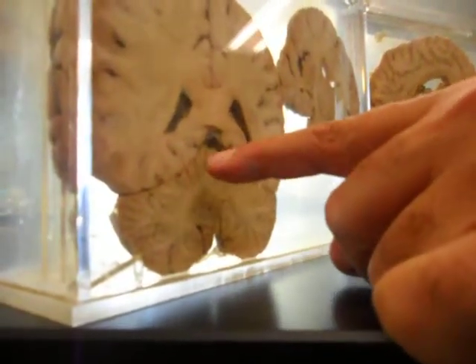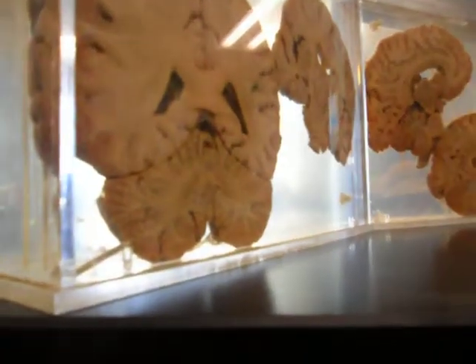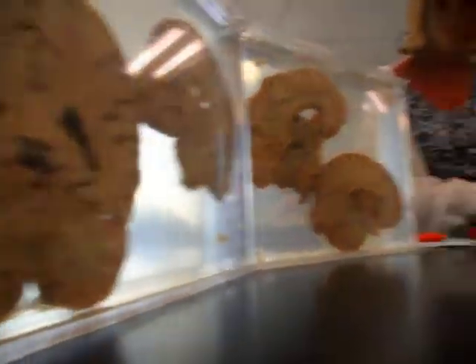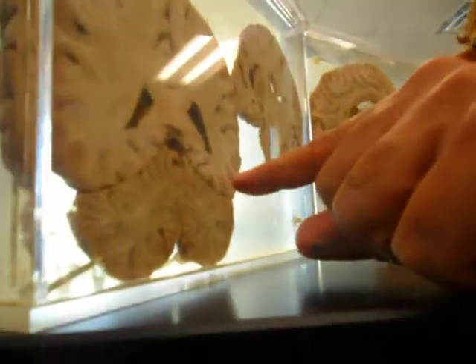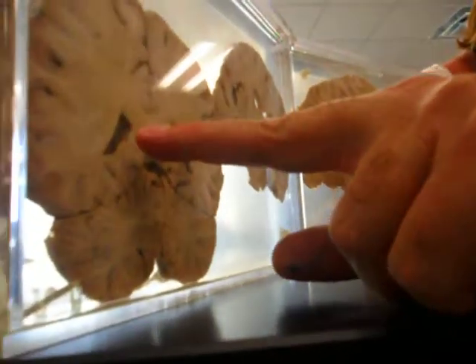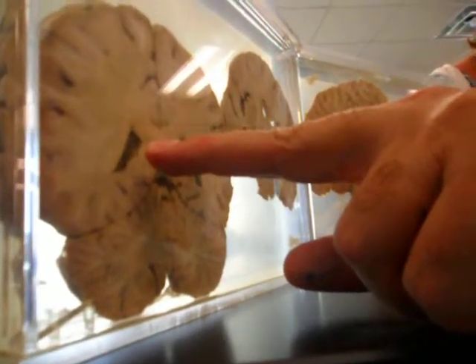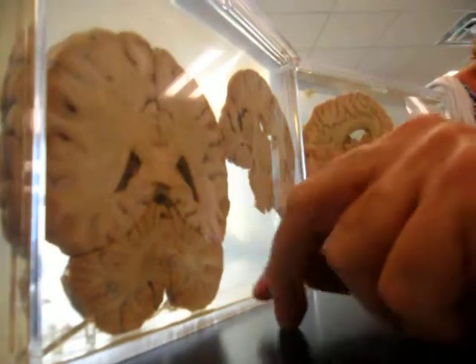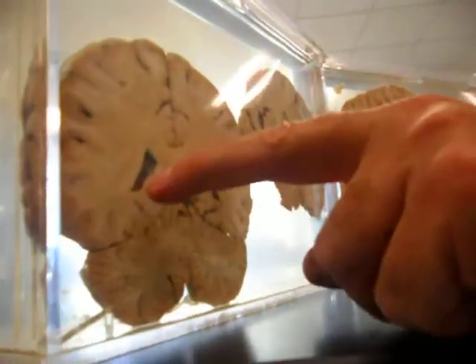The parietal occipital? Nope. Or occipital parietal? Nope. What line separates the cerebellum from the cerebrum? Transverse fissure. So that's got to be the transverse fissure. What holes are these? They're the same as these two holes. Lateral what? Ventricles. Okay. There's some blood capillaries inside these ventricles.